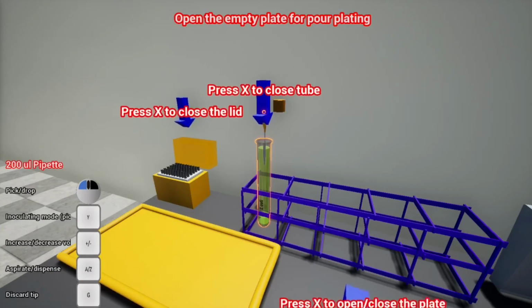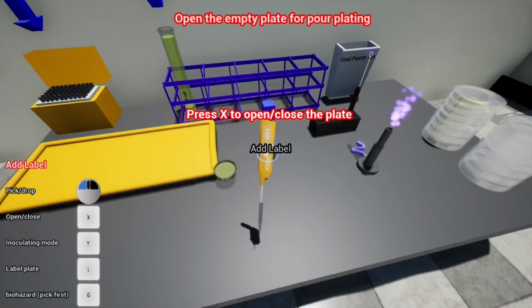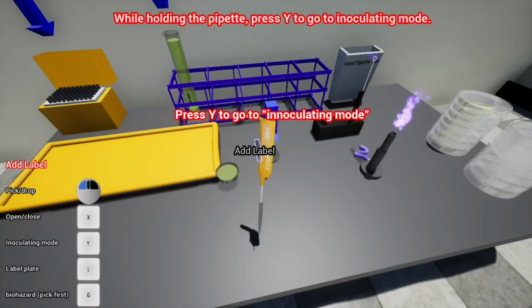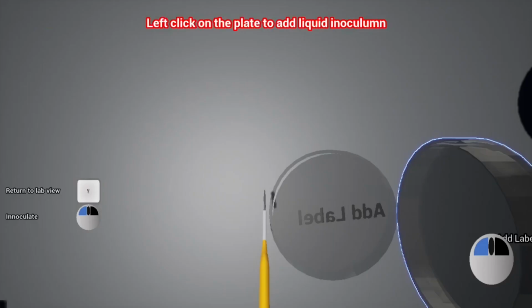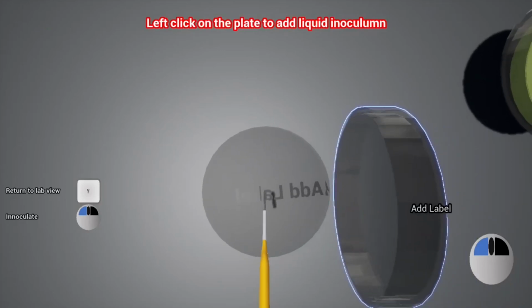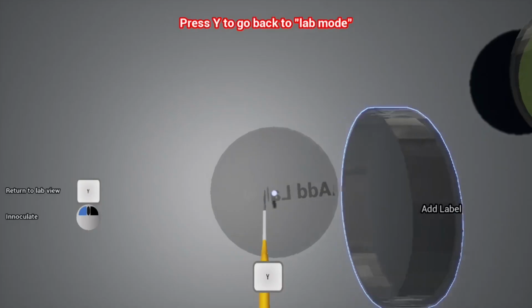Open the empty plate for pour plating. Okay, I'm gonna open it up. While holding the pipette, press Y to go to inoculating mode. You can't go into inoculating mode unless you're holding something that can inoculate, like a loop or a pipette. So while I'm holding this, I'm gonna press Y. Plate to add liquid inoculum. So I'm gonna add some liquid inoculum right at the center of the plate. Go back to lab mode, and place the pipette back in the tray.